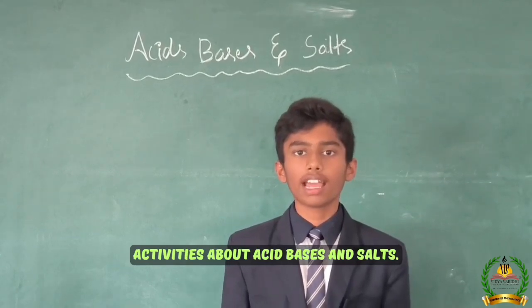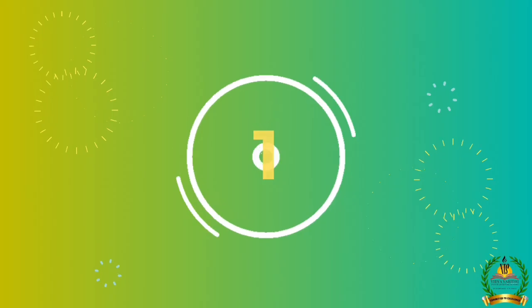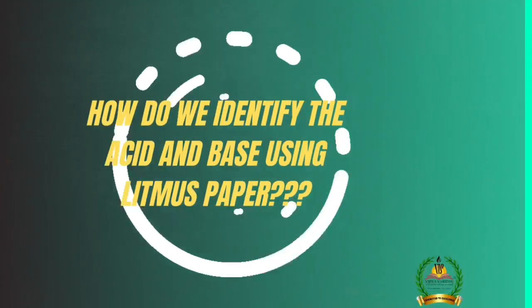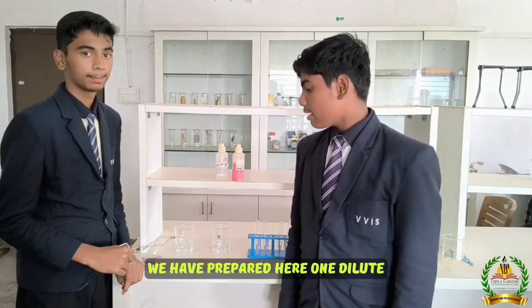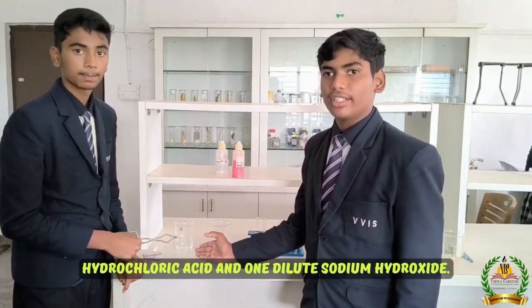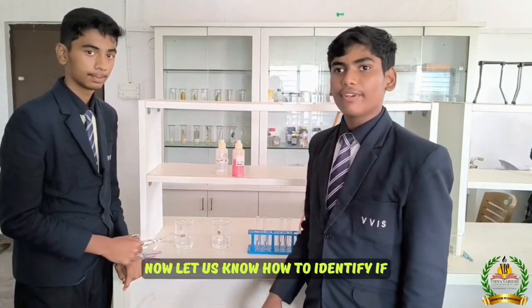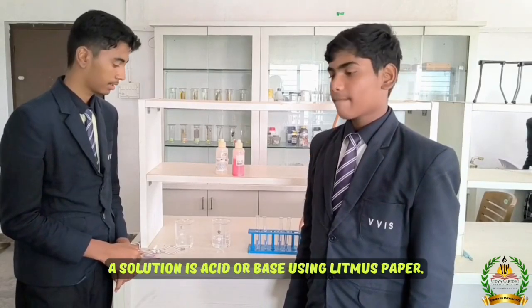Provided some activities about acids, bases and salts. Today we are here to represent how to identify an acid or a base using litmus paper. We have prepared one dilute hydrochloric acid and one dilute sodium hydroxide. Now let us learn how to identify if a solution is an acid or a base using litmus paper.